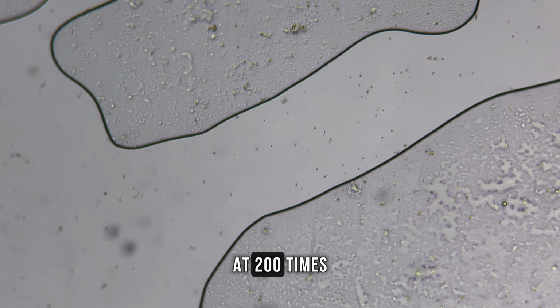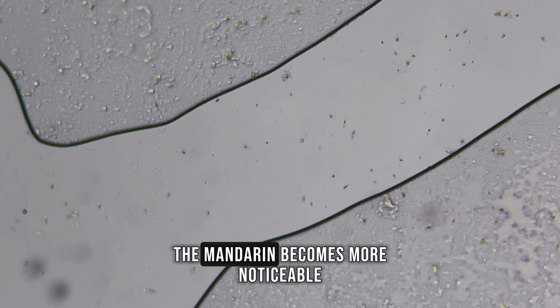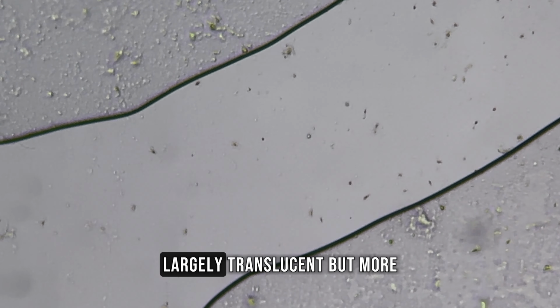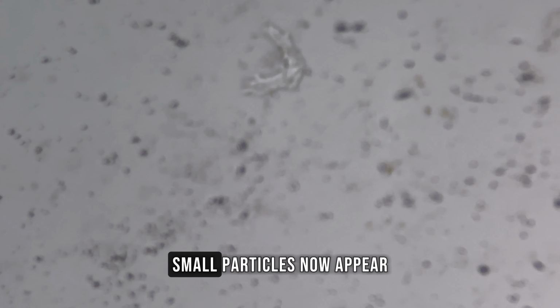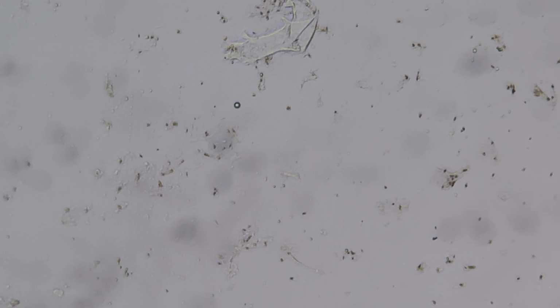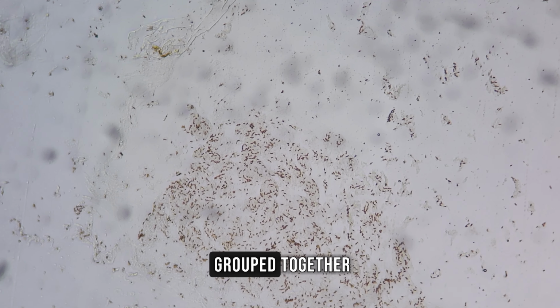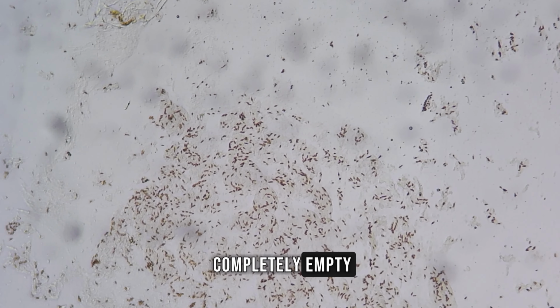At 200 times magnification, the internal organization of the mandarin becomes more noticeable. The background remains largely translucent, but more detail begins to emerge. Small particles now appear more clearly defined. They are scattered unevenly across the sample. Some areas show clusters of tiny rounded elements grouped together. Other regions remain almost completely empty.